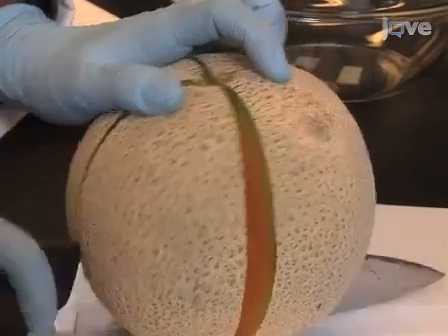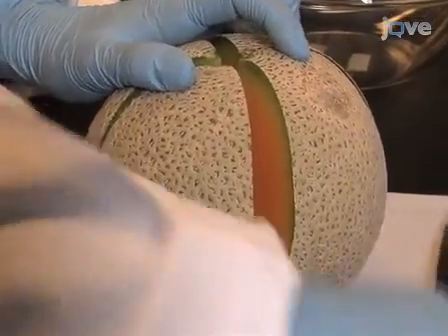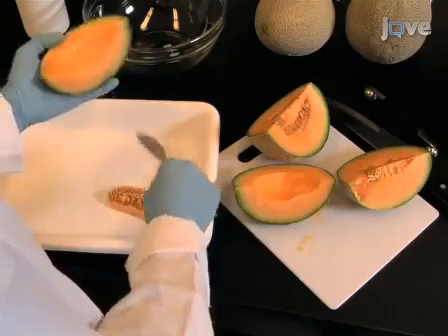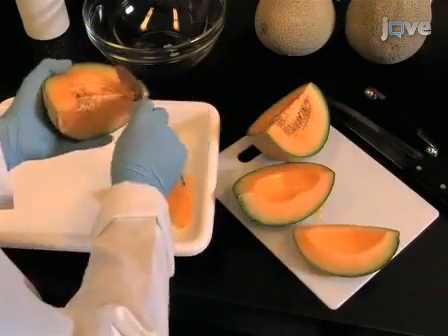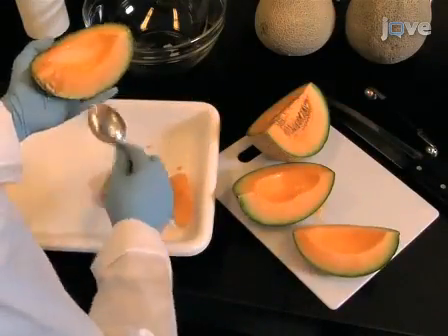Cut fruits longitudinally into wedges to be used for volatile sampling. If applicable, remove skin, seeds, seed cavity tissue, or pit.